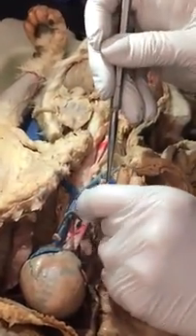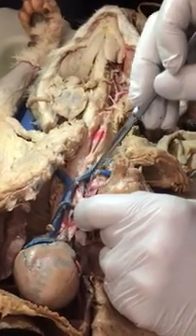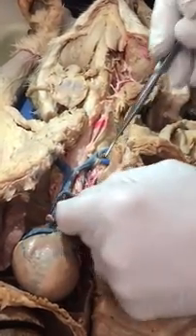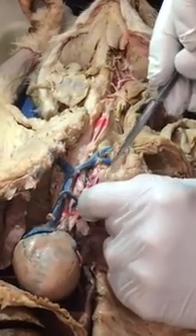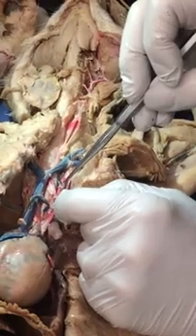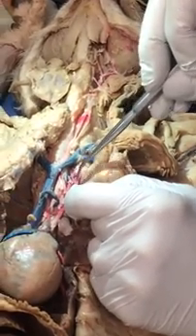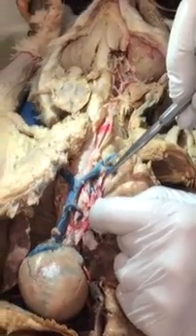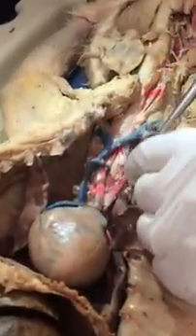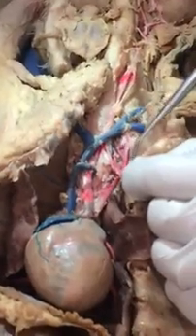You got a great VCT there also. Vertebral, costocervical, thyrocervical. What am I holding on to right here to pull it? Internal mammary. That's good. And what is this one that they come off of? Brachiocephalic. No, this is subclavian. That's good. Brachiocephalic is under the internal, and you said on most cats higher up, right? Yeah. See, yours is weird. It's usually right in here.